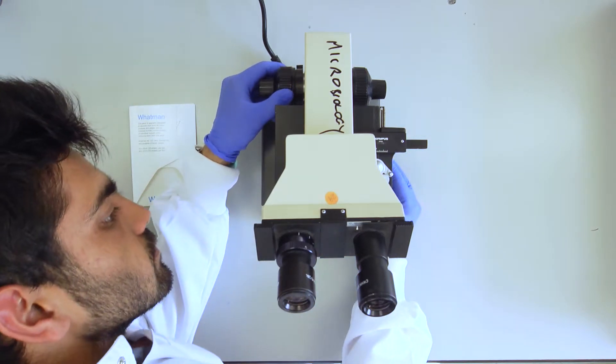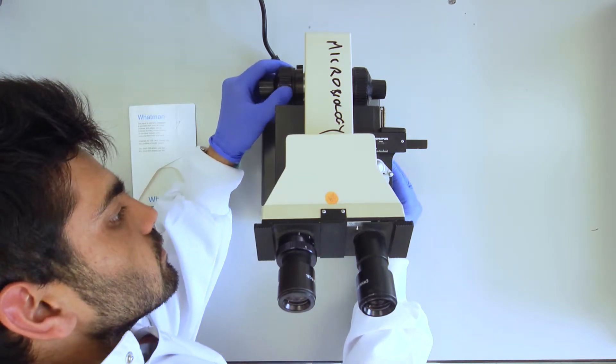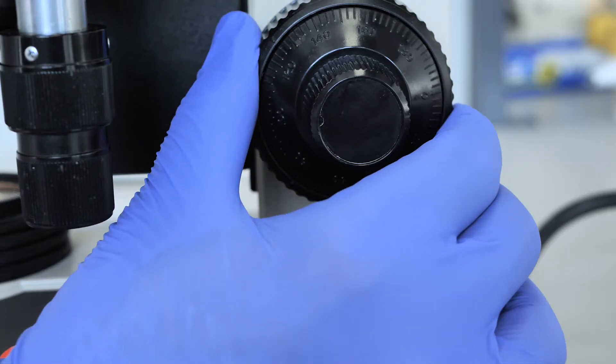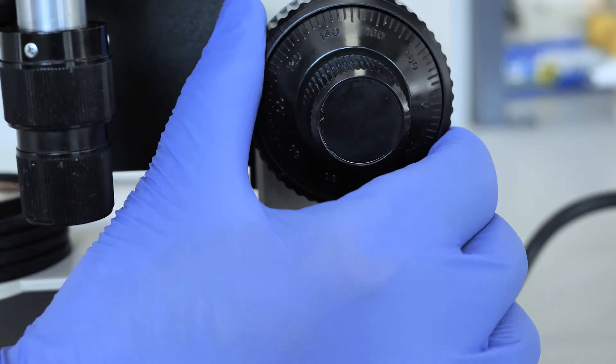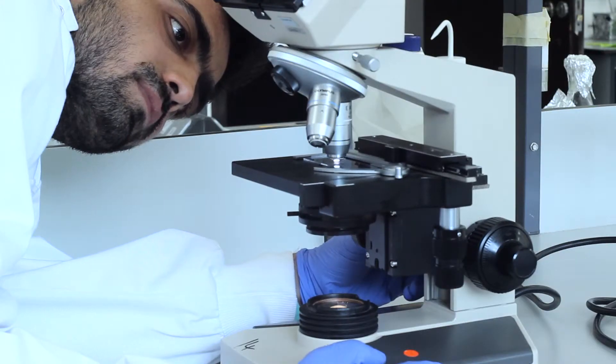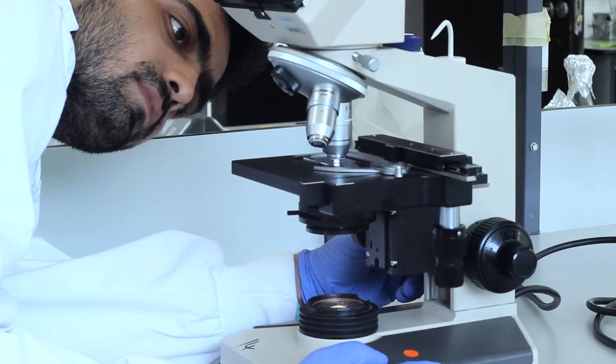While looking from the side, turn the coarse focusing knob until the lens touches the drop of oil.